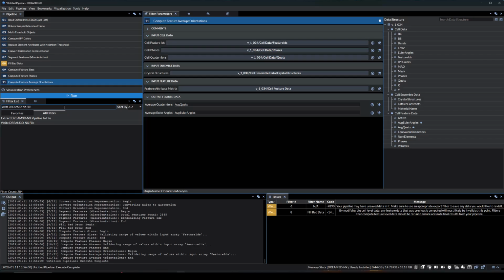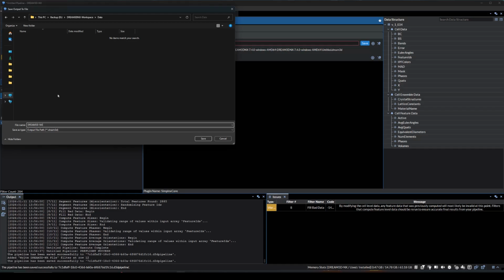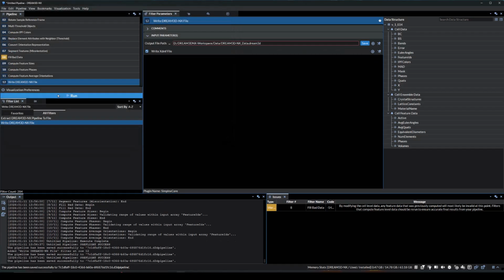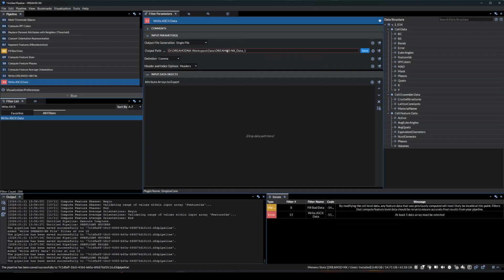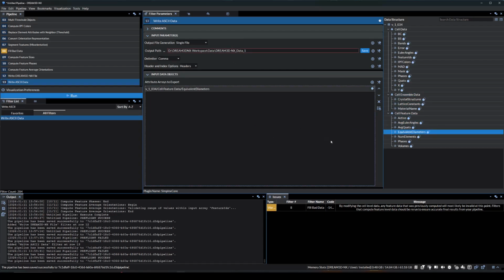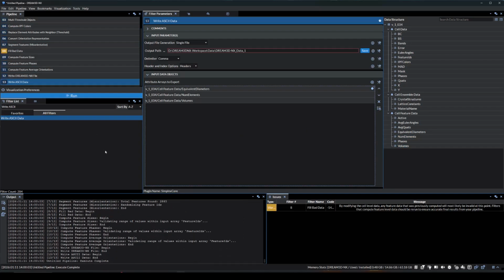Now we can add a Write DREAM3D-NX file filter to save our pipeline data. Finally, we'll add a Write ASCII data filter. We'll add the path we want to save our output data to, then we'll add equivalent diameters, num elements, and volumes objects to export. Run the pipeline with these added filters to save your DREAM3D-NX file and ASCII data.